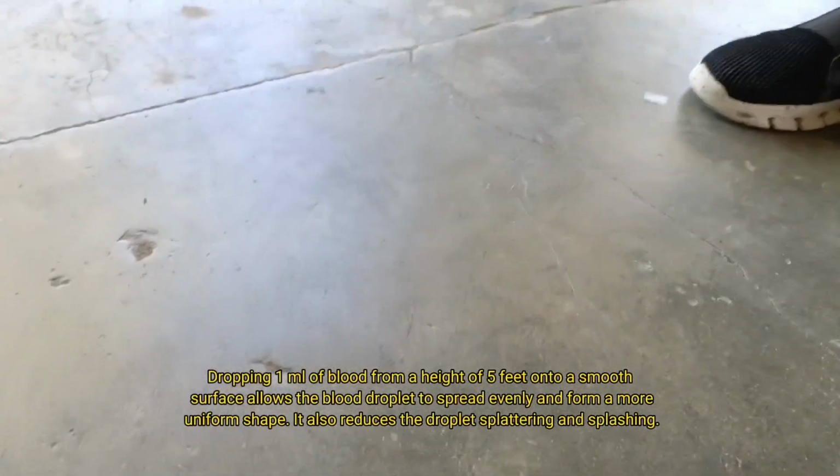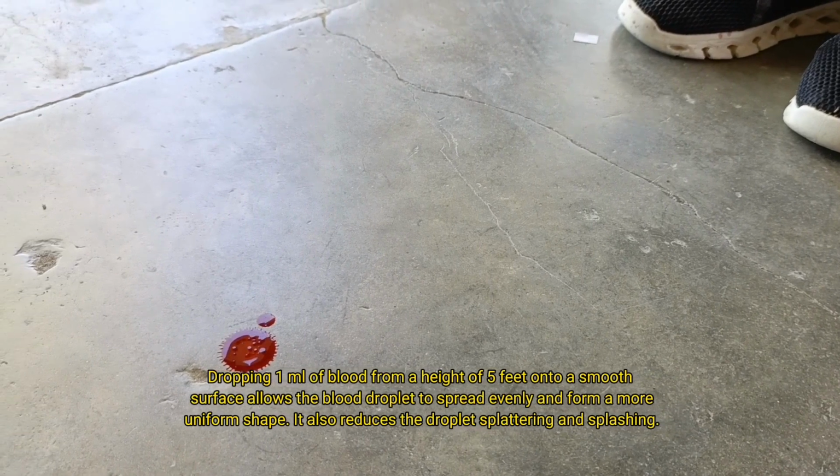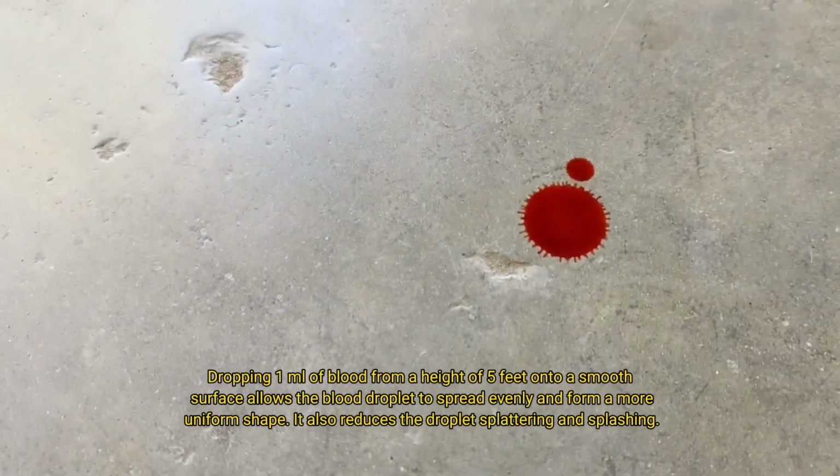Dropping 1 milliliter of blood from a height of 5 feet onto a smooth surface allows the blood droplet to spread evenly and form a more uniform shape. It also reduces the droplet splattering and splashing.